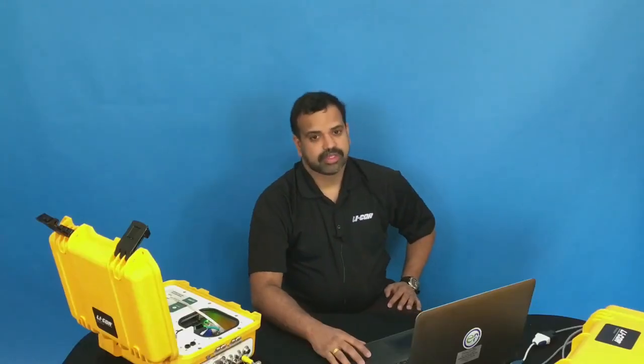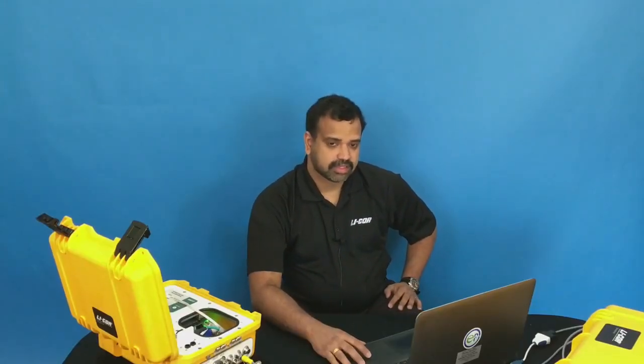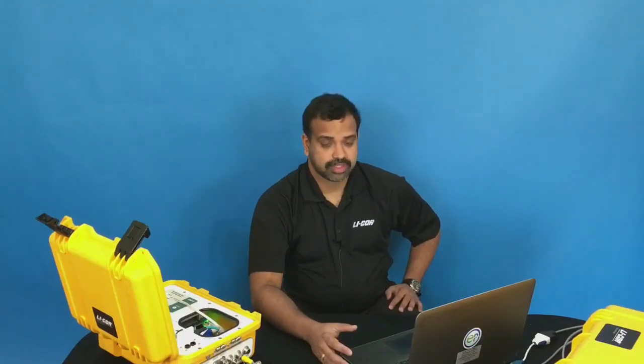Soil Flux Pro is an excellent software for data analysis, transformation and QA/QC of soil respiration data. Make sure you watch this additional video we have on the Soil Flux Pro on our website.